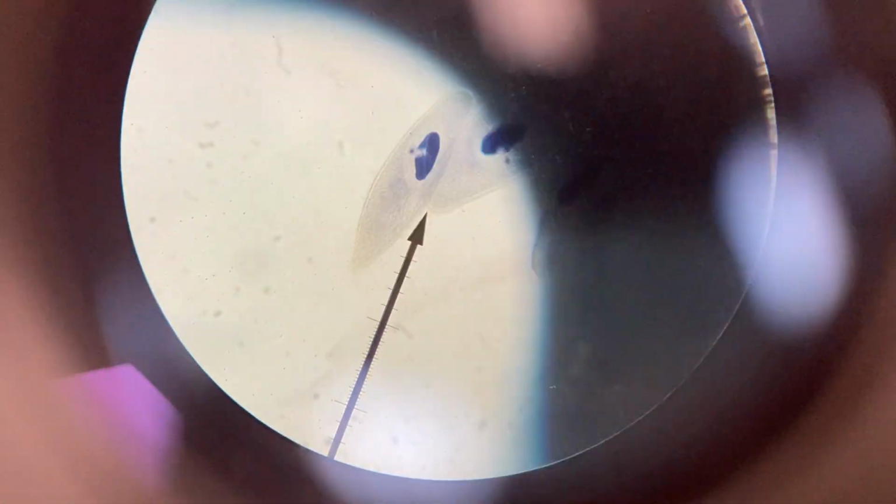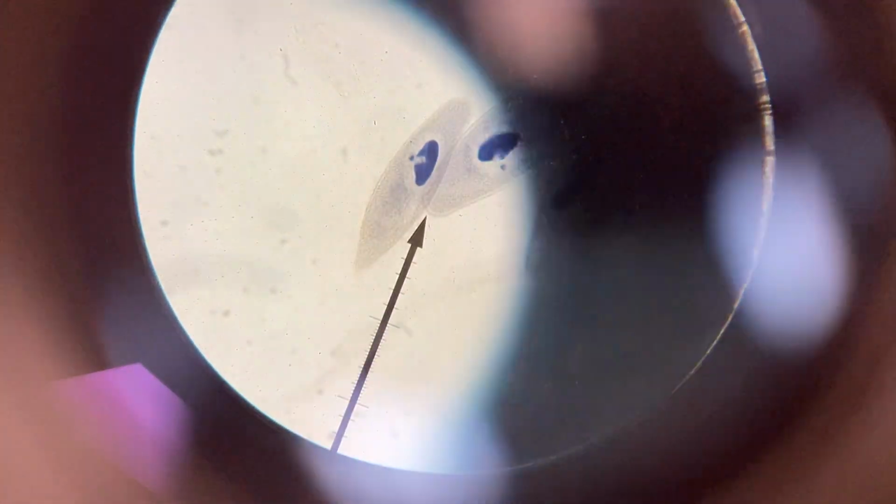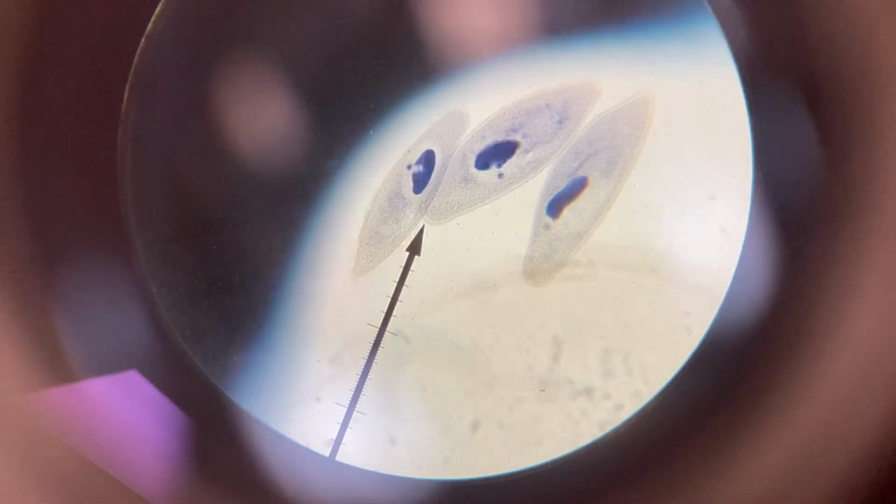Okay. A picture of the Paramecium here. There's a pretty good shot. There's 3 of them down there. The cilia are going to be tiny hair-like things around the outside and how it moves. The oral groove's pretty hard to see. You're probably not going to see it on this. The oral groove is just a little slit along the side of the Paramecium where it rakes bacteria, which it eats, into its gullet.